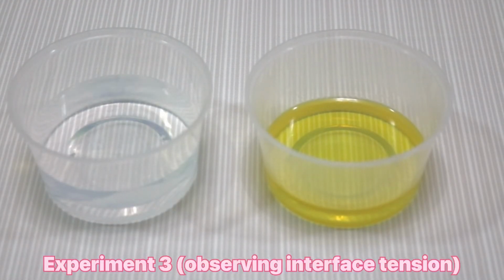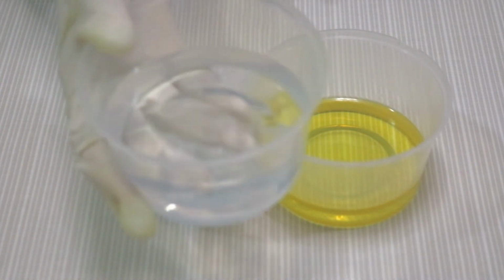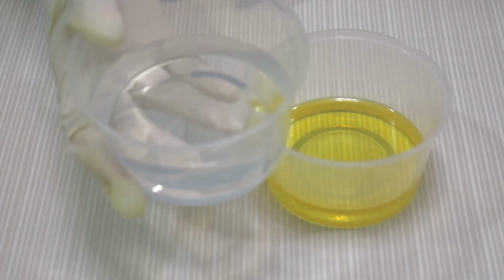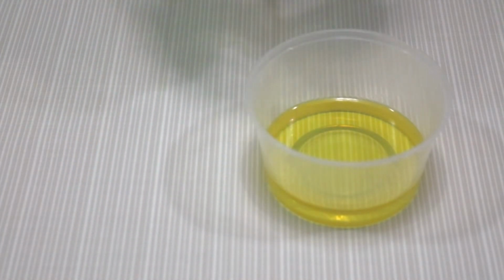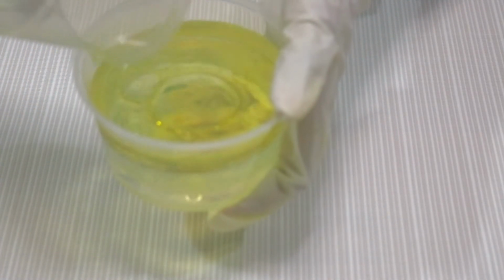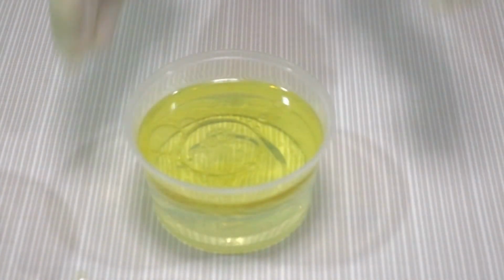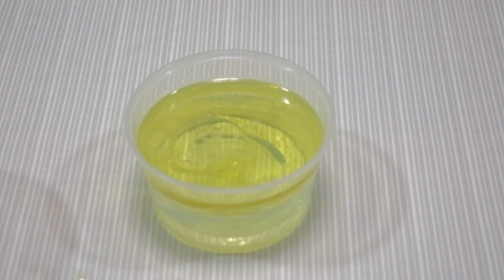The next is experiment 3. This experiment is used to observe interface tension. In this video, I am using water and some cooking oil. Next, I'm going to mix the water with the cooking oil and we will see what happens. As you can see in this video, there are two phases, right? It is water and oil.